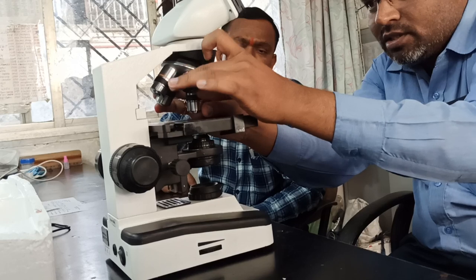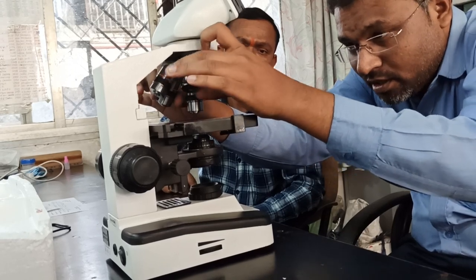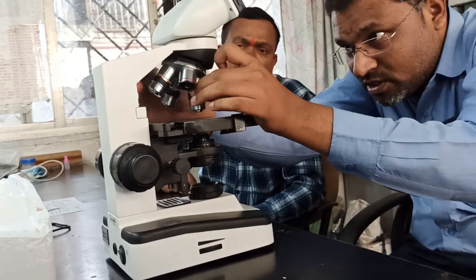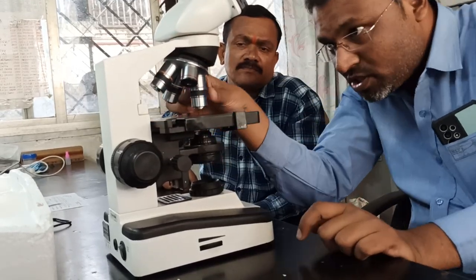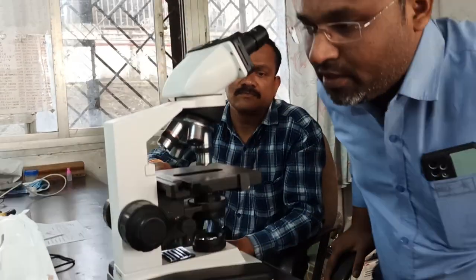Whenever you are assembling things, keep one thing in mind: don't touch the open surface of the lens. Otherwise, whatever dust is present on your hand will be sticky and it will blur the vision, right?